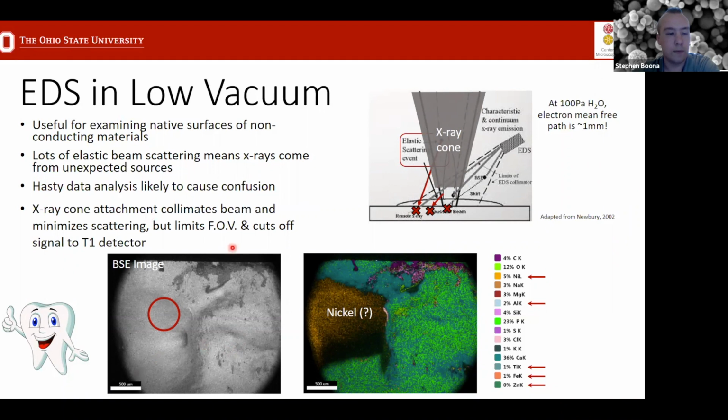And so instead of being able to look at an image area like this, which is about the diameter of the pole piece attachment, you get much more reliable results out of it. So there's a big trade-off to be made, but you can decide for yourself what is appropriate for your samples. And if you need some help, I'd be happy to assist you with that.